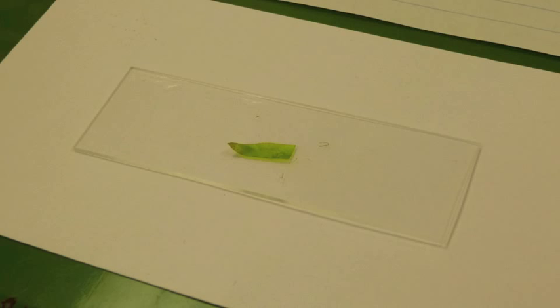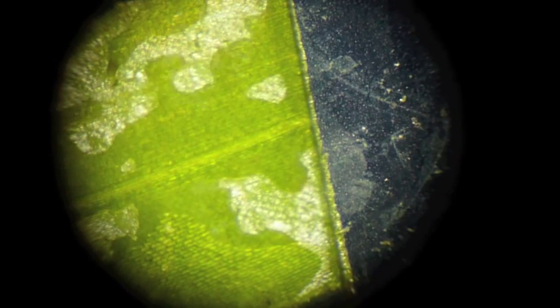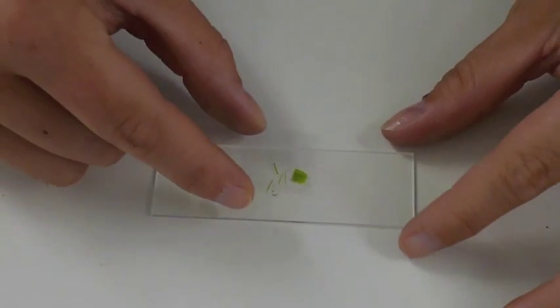Make small, thin slices across the leaf. In order to view your cross-section slices, place a cover slip over the leaf.